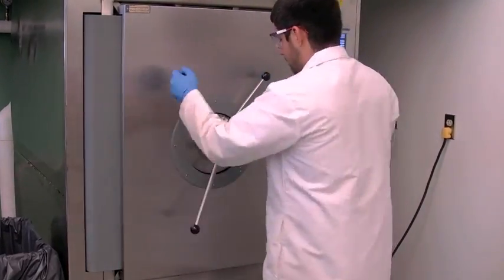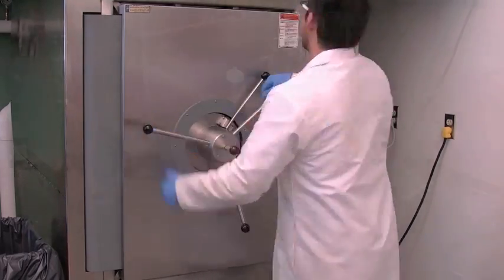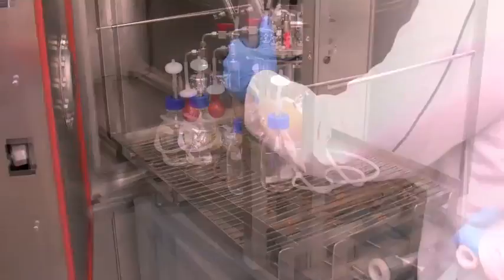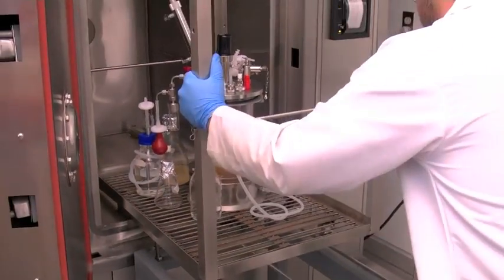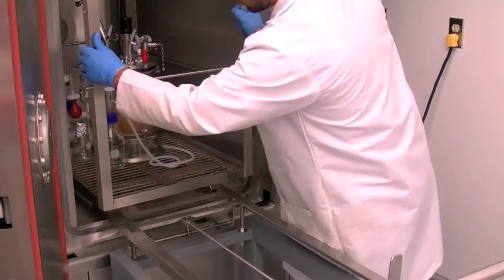Open the autoclave doors by cranking the wheel all the way counterclockwise. Load the autoclave cart into the autoclave. Close the autoclave doors by cranking the wheel all the way clockwise.